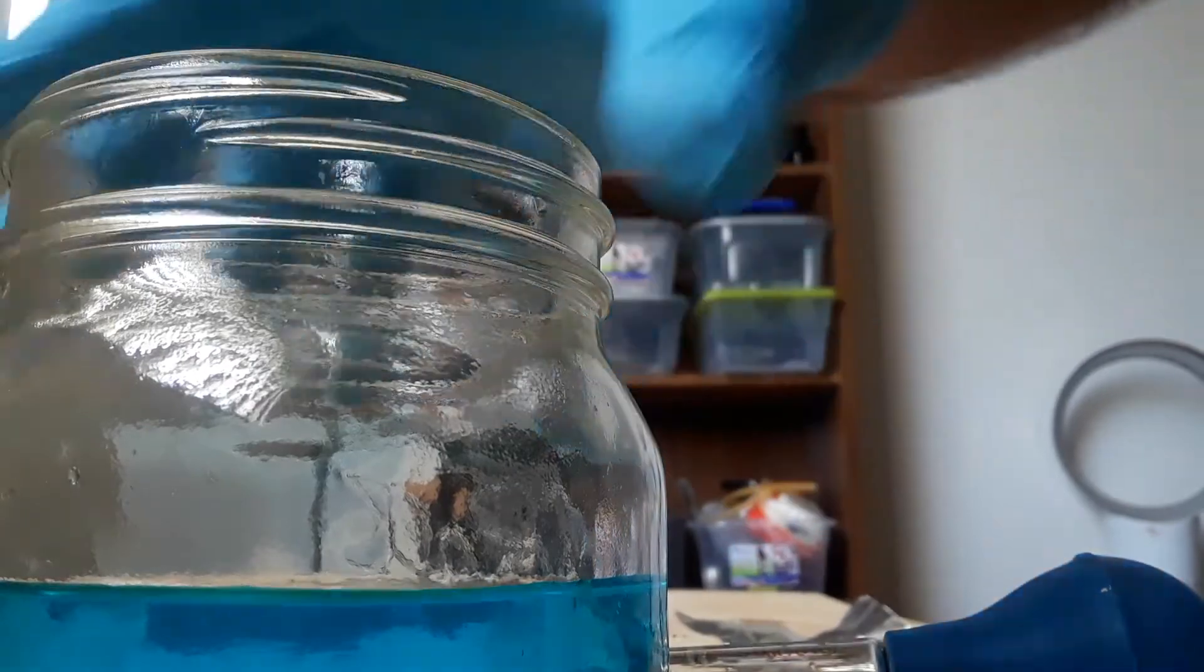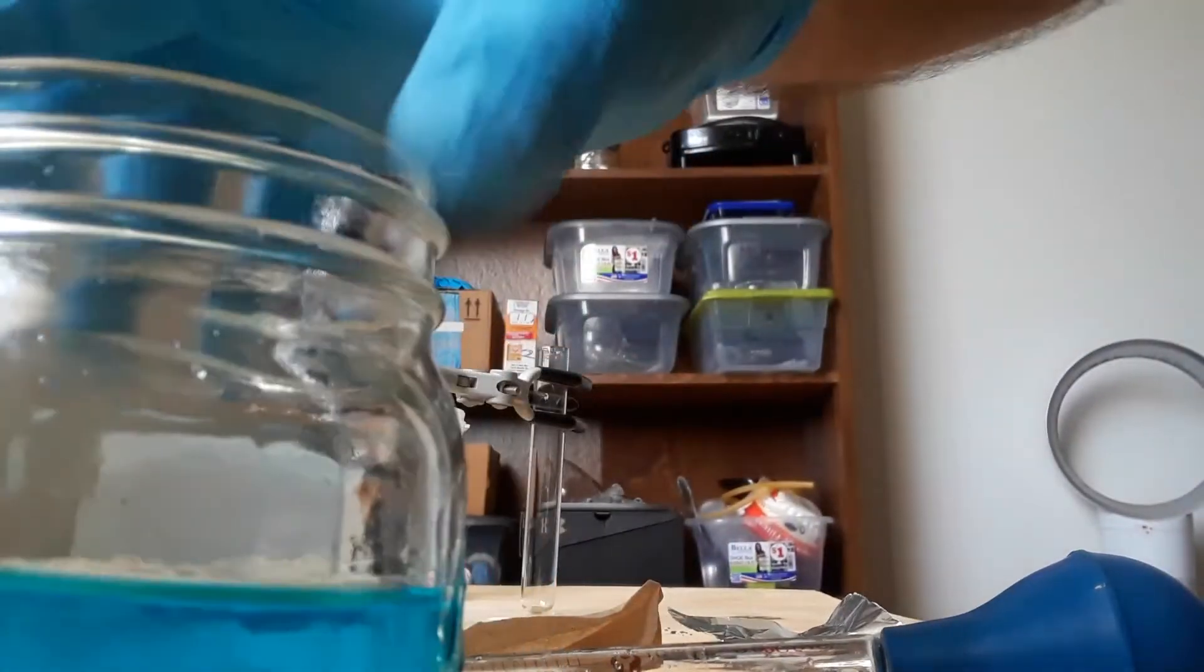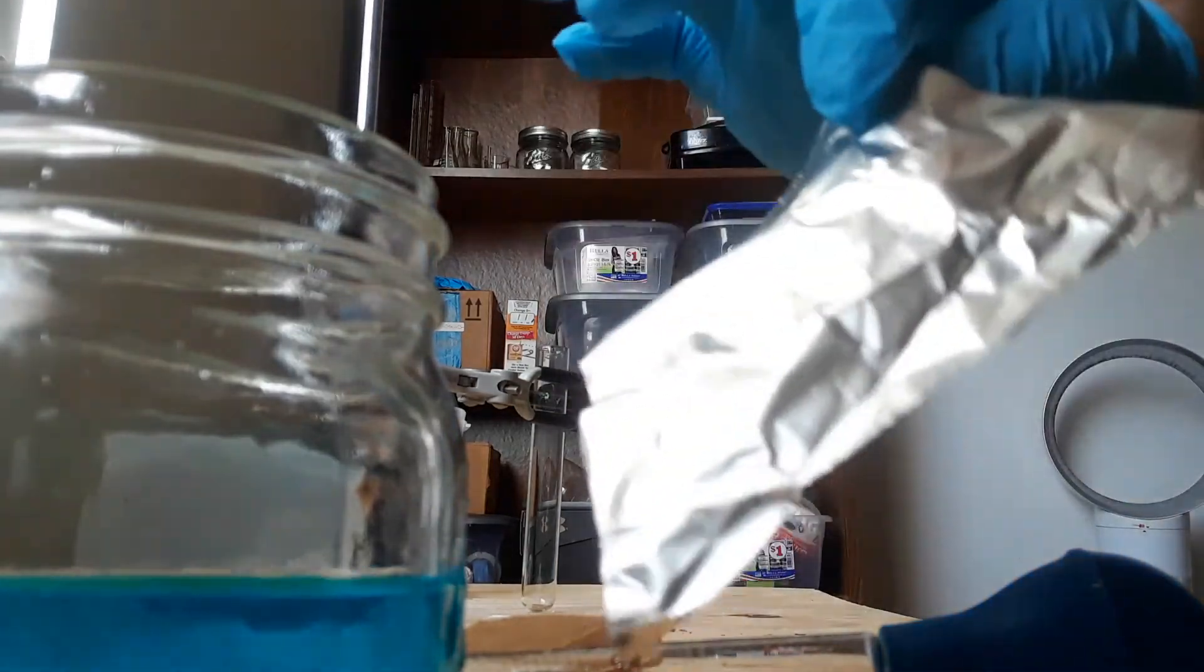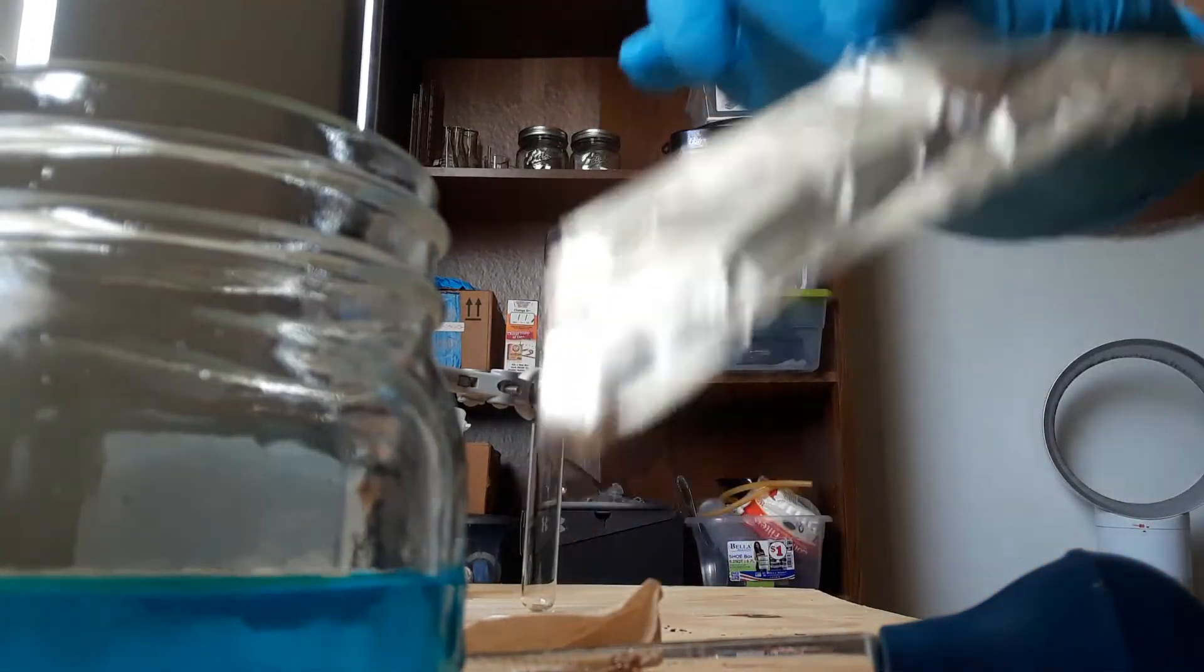I wanted to do this originally with iron because iron is higher on the reactivity series than copper and below zinc, but I'm going to use aluminum foil instead because I don't have any pure sources of iron.